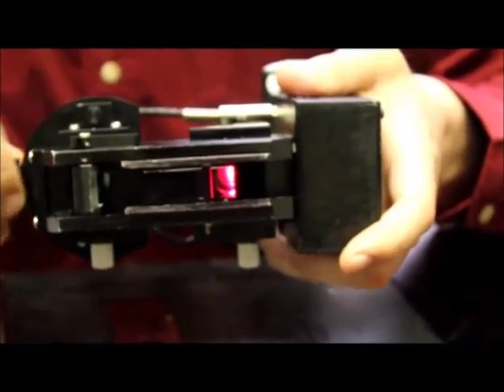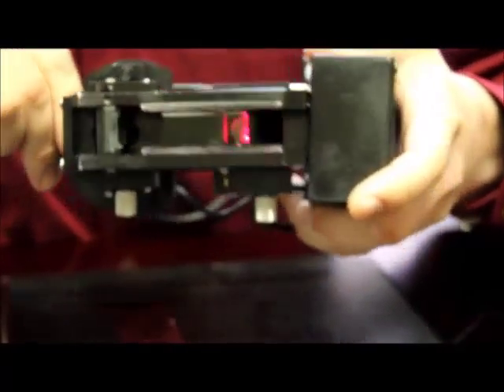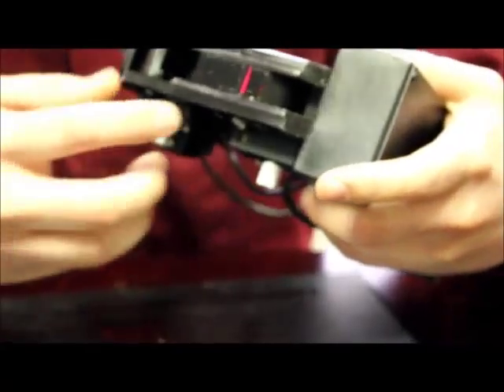If we see all of this, then the GASP is electronically working properly. The next step is to place the prisms directly on top of the index matching fluid that we've placed earlier.